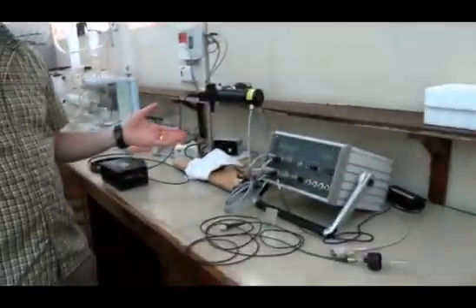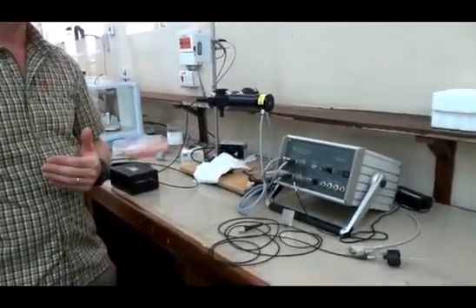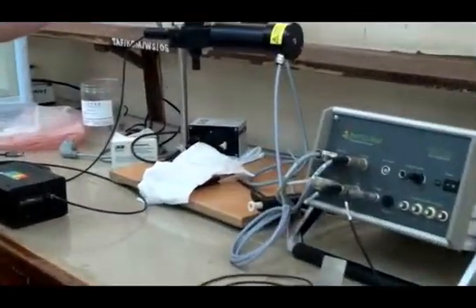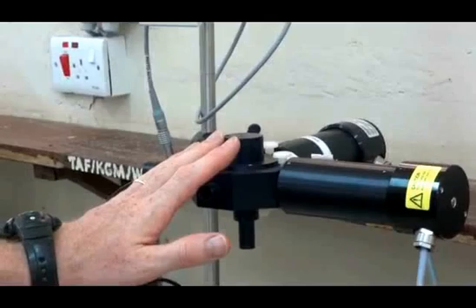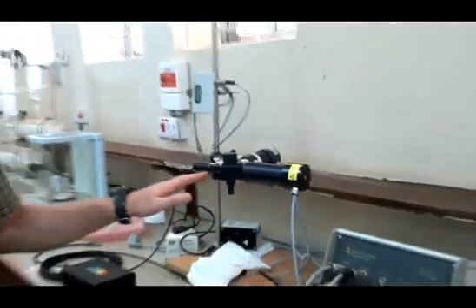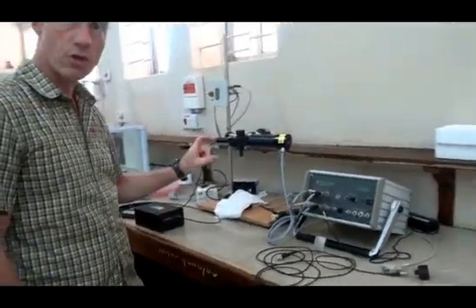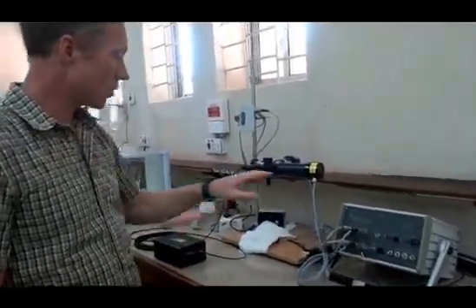This is an instrument we use to measure the rate of primary production in the lake. We take samples at various depths, put them in the holder, and measure with a very sensitive instrument the rate of production caused by these microscopic phytoplankton cells.